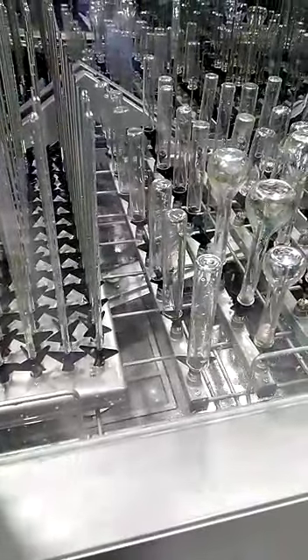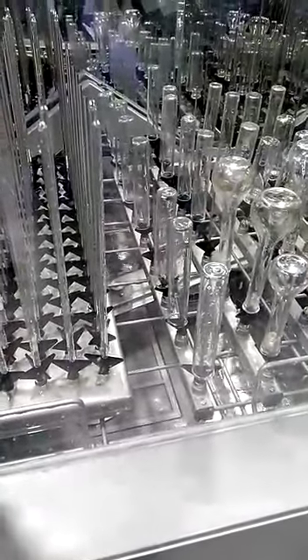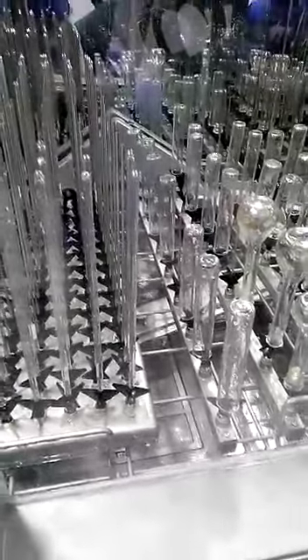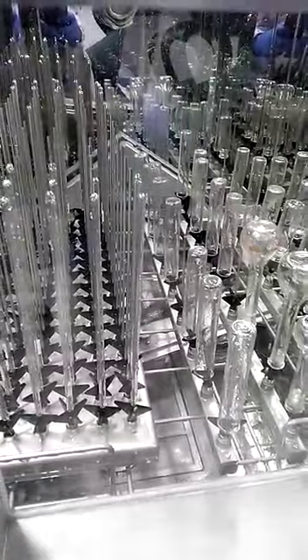The water will get drained off by the automatic system of draining, which is programmed in the method. After this, it will take a few minutes and it will start drying.